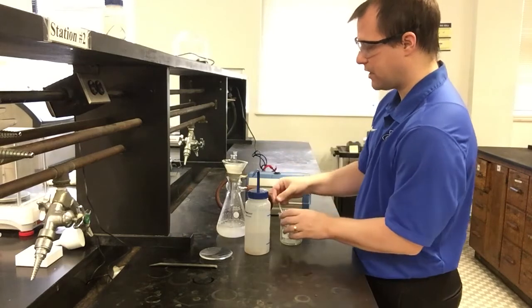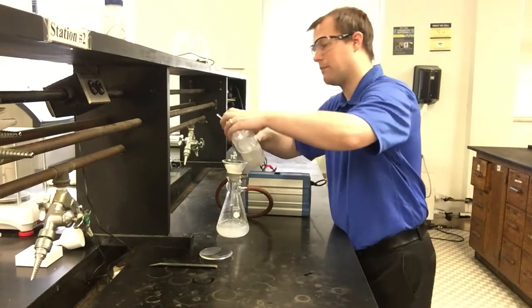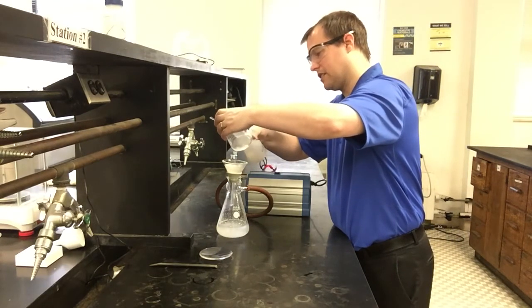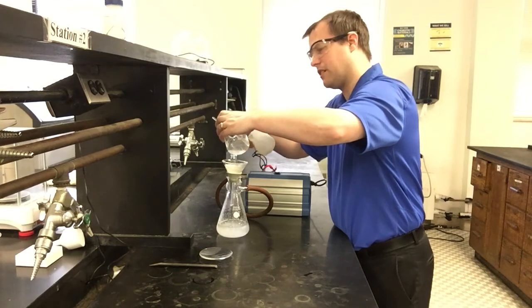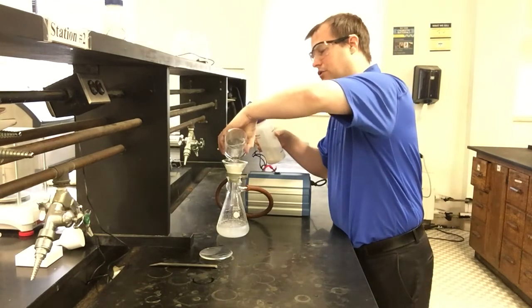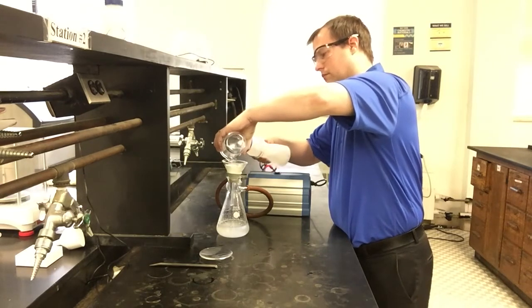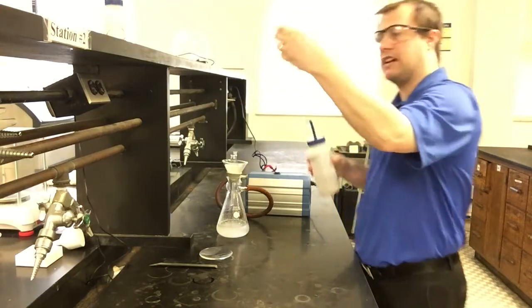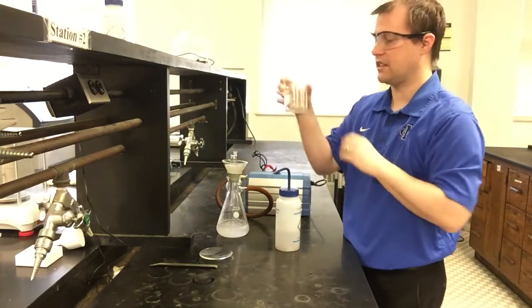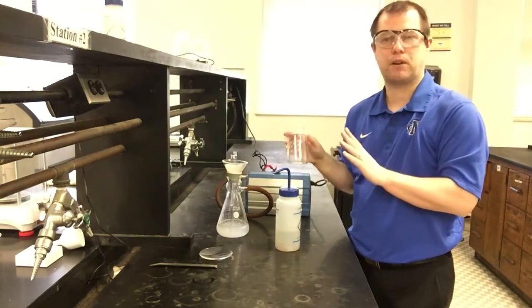Right, so our liquid level is getting pretty close down to the bottom now. With the last bit of my beaker, I'm going to squirt my stirring rod and the contents of my beaker to make sure I get any last bit of my product into my filtration setup. That way my beaker should now be pretty clear. It shouldn't have a lot of white dust still sitting in it, because that's probably product. There might be a tiny, tiny bit still left, but for the most part it looks like I got all of it.